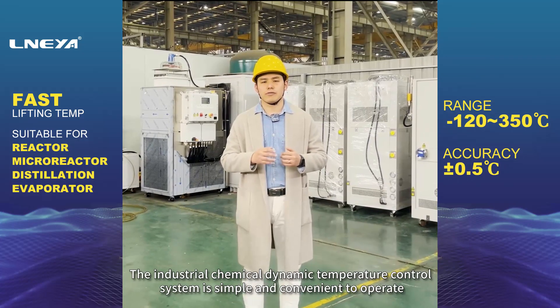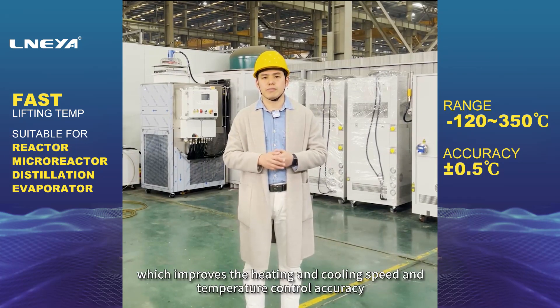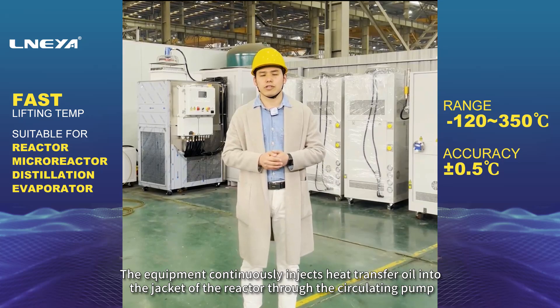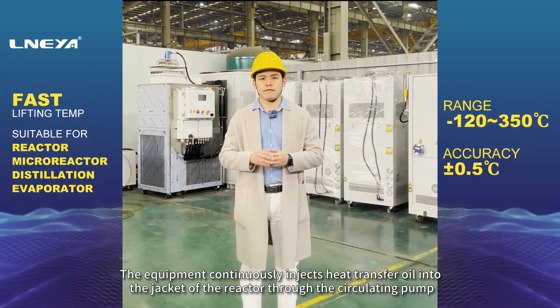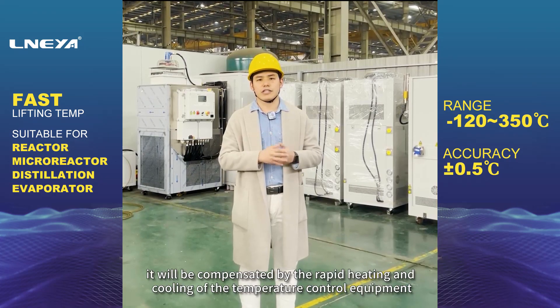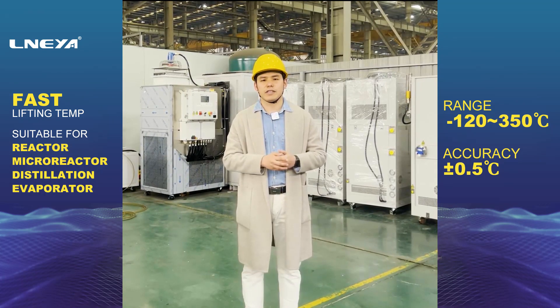The industrial chemical dynamic temperature control system is simple and convenient to operate, which improves the heating and cooling speed and temperature control accuracy. The equipment continuously injects heat transfer oil into the jacket of the reactor through the circulating pump. When the reaction temperature inside the reactor changes drastically, it will be compensated by the rapid heating and cooling of the temperature control equipment to achieve dynamic balance.